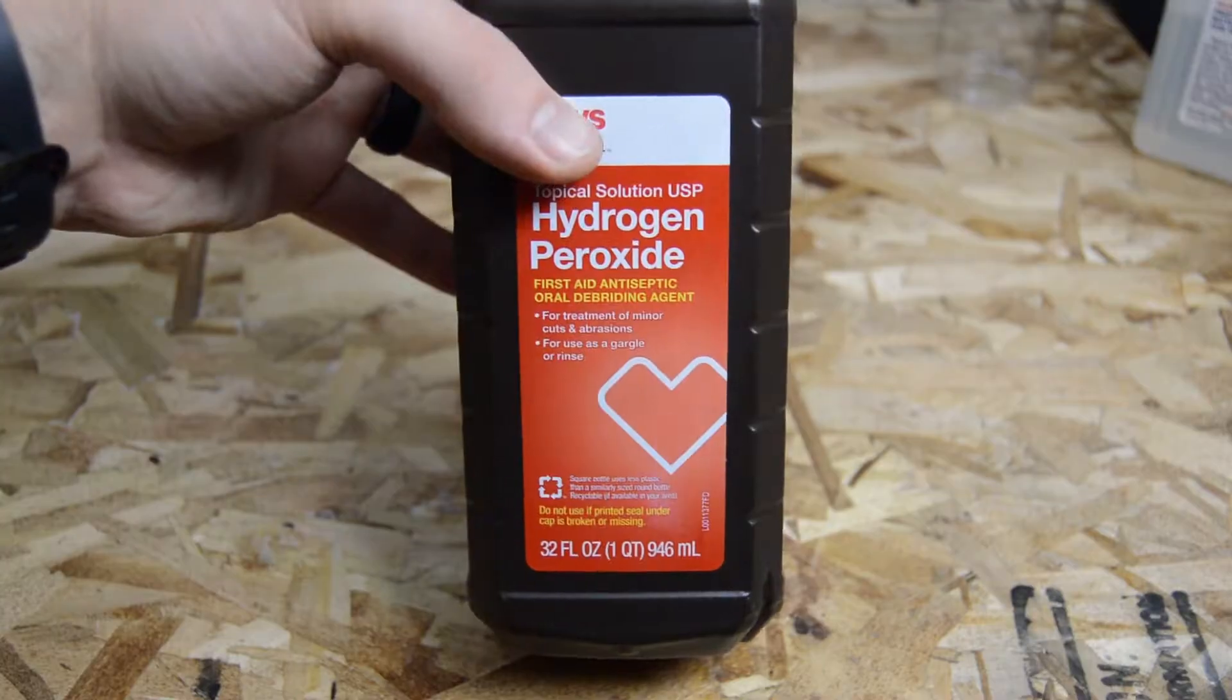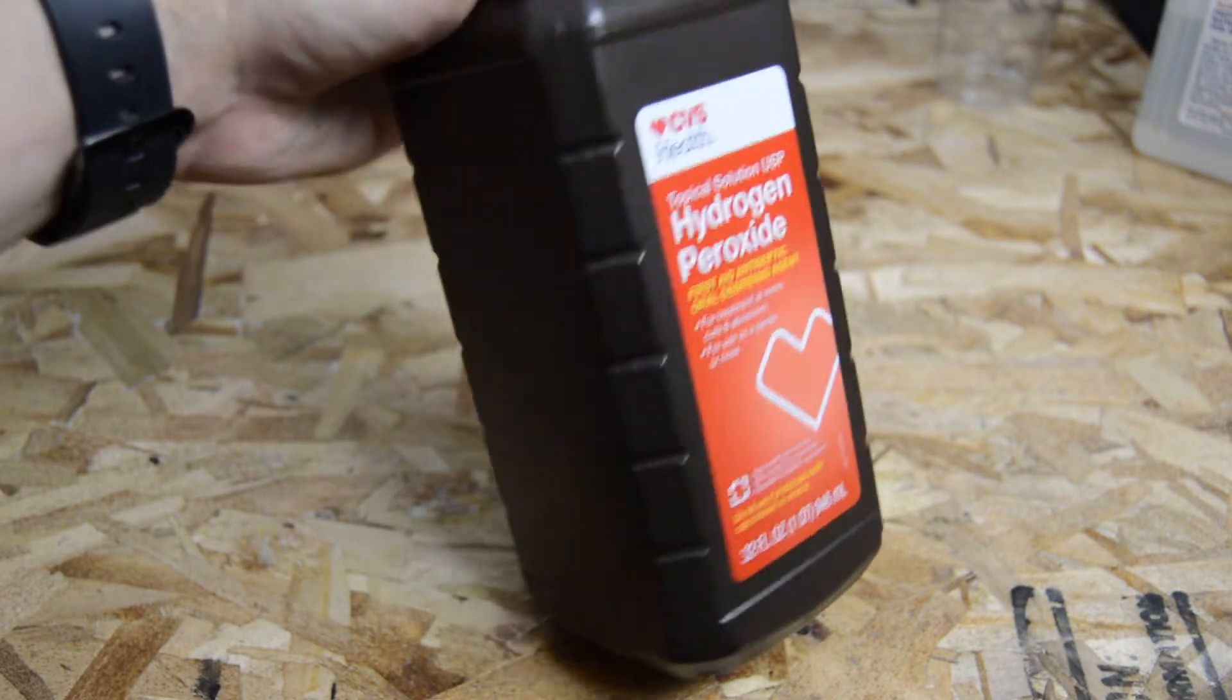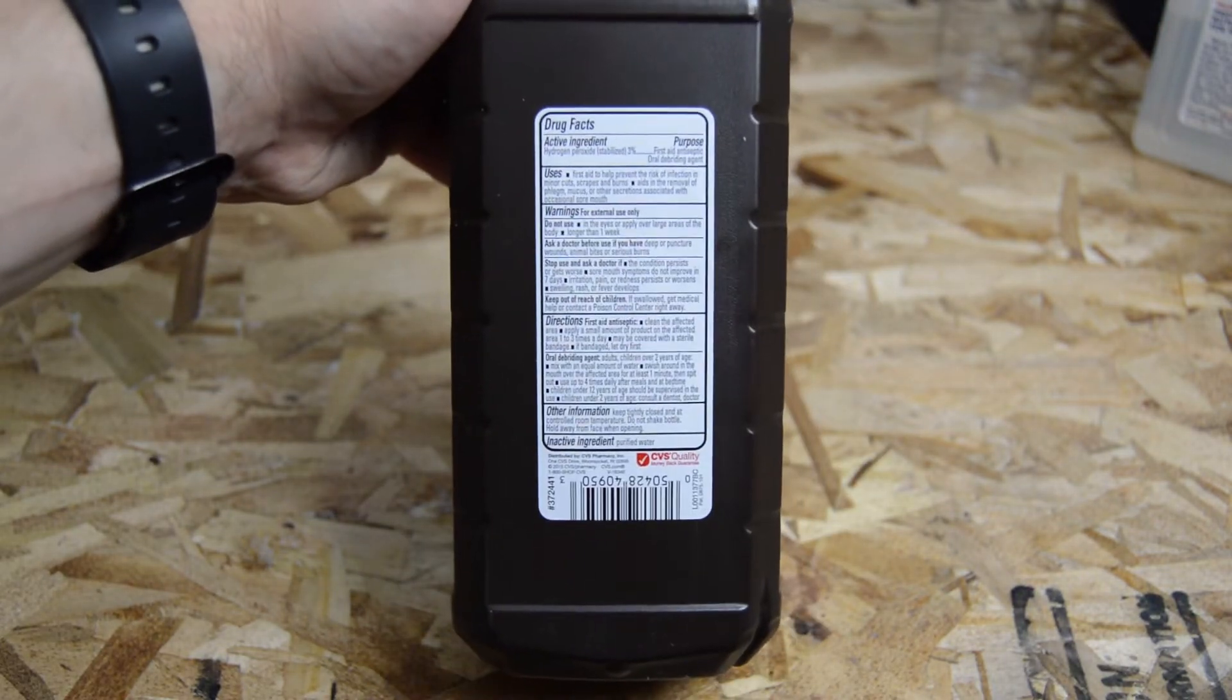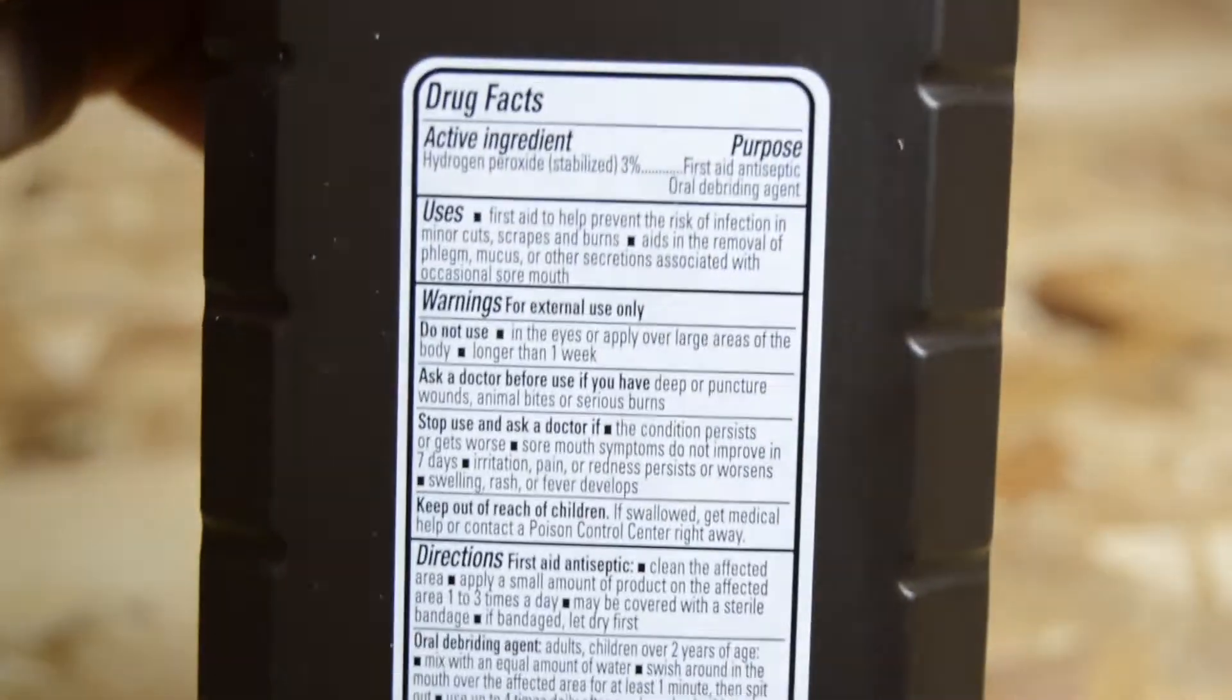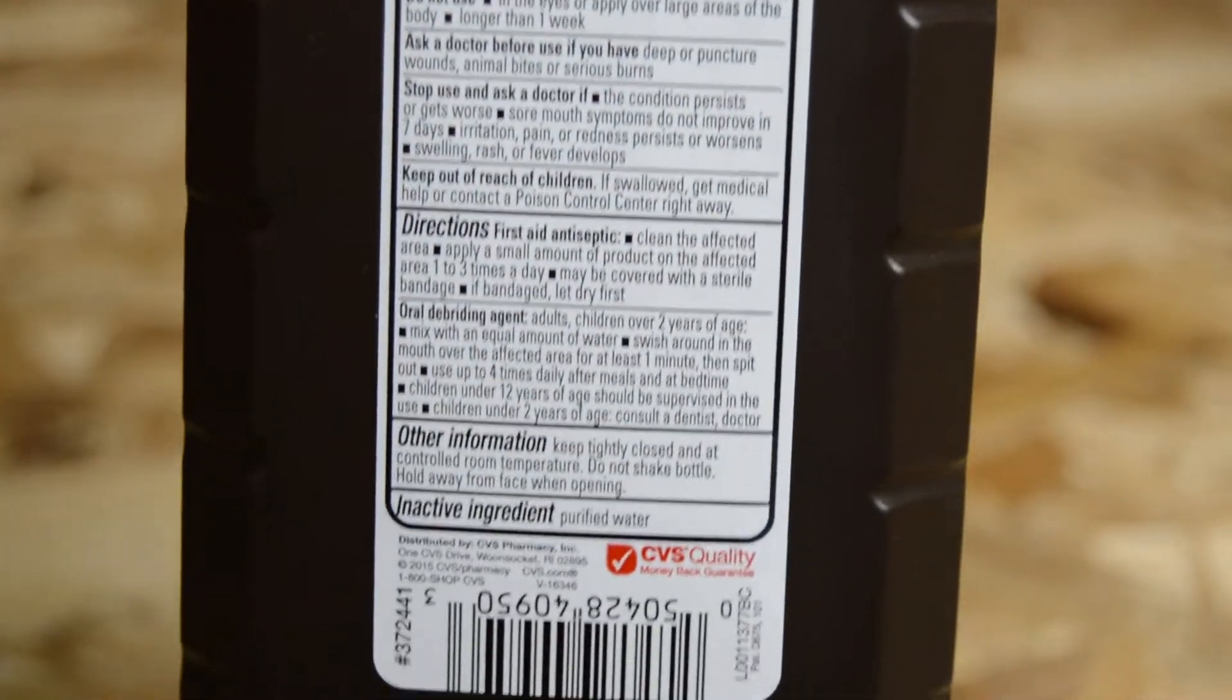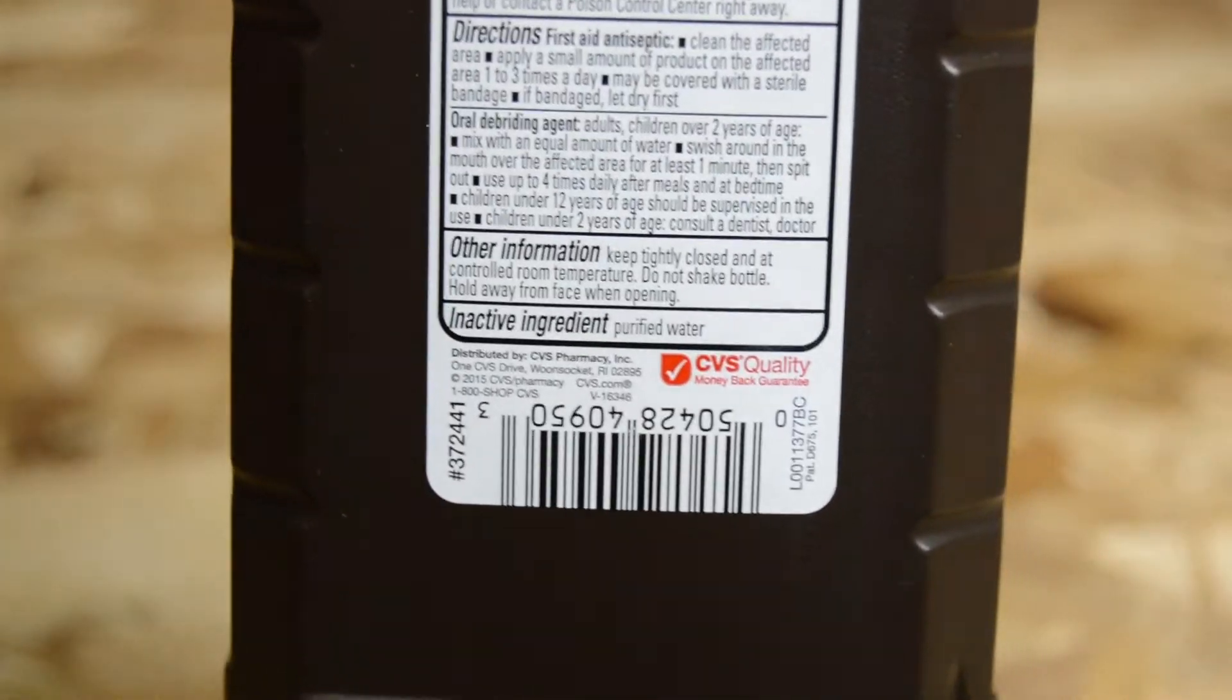The last ingredient is what makes this whole experiment a lot more safe and that ingredient is hydrogen peroxide. The hydrogen peroxide I used was 3% by weight, but if you can get it in higher concentrations that's better. I'll explain why later.